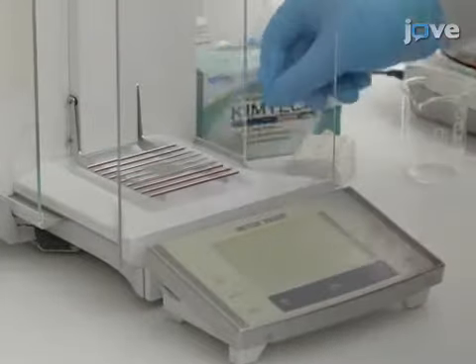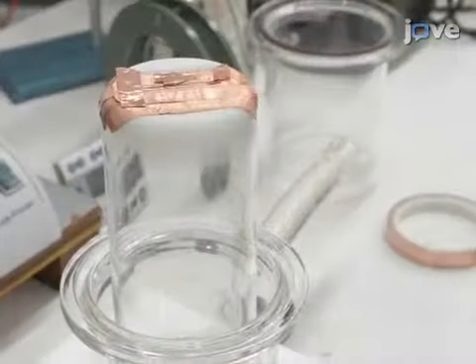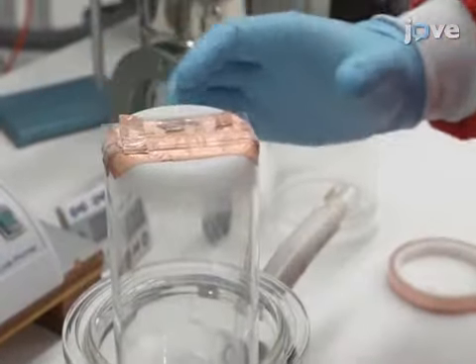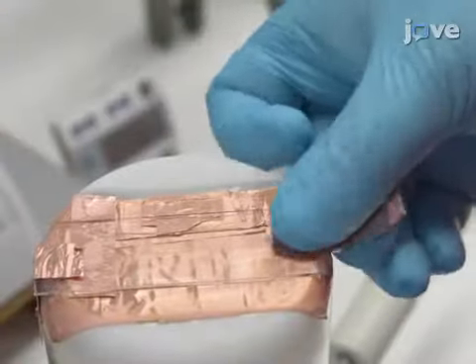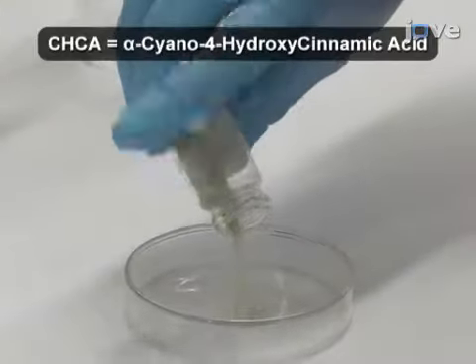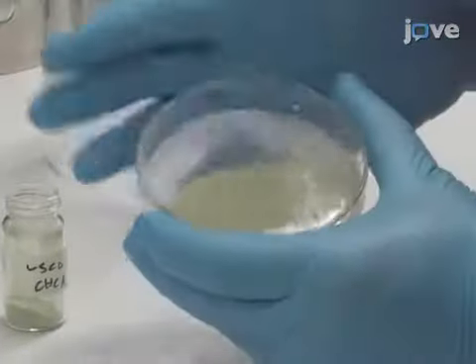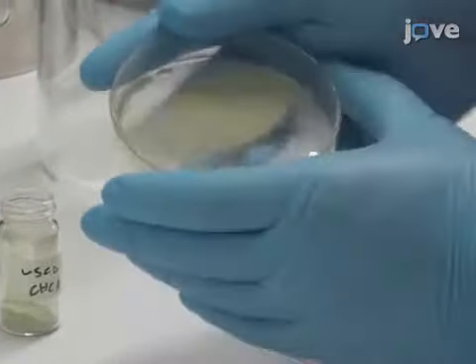Once digested, weigh the sample slide on a 5-digit microanalytical balance. Mount the slide onto the cooling finger of the sublimation apparatus and secure it with copper tape in the same way as described for the vapor chamber. Place 300 milligrams of CHCA matrix into a glass petri dish at the bottom of the chamber and spread it evenly to create a thin layer of matrix crystals.